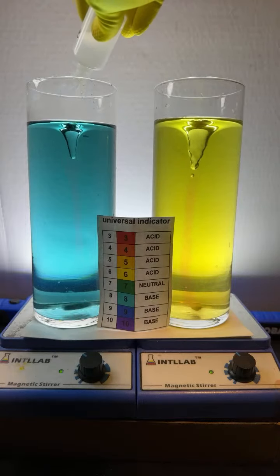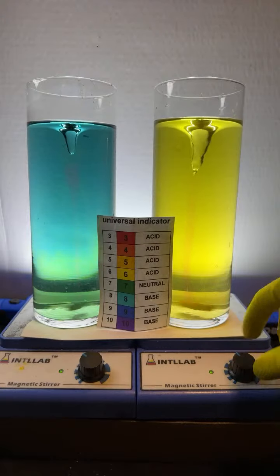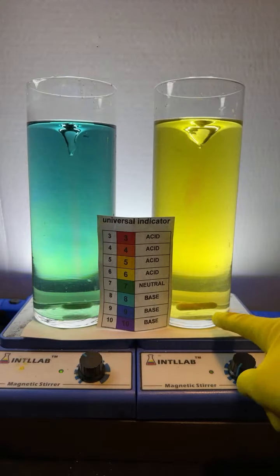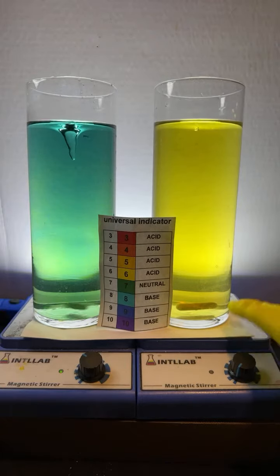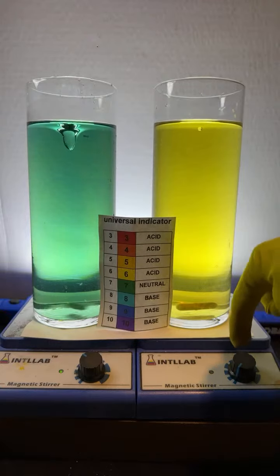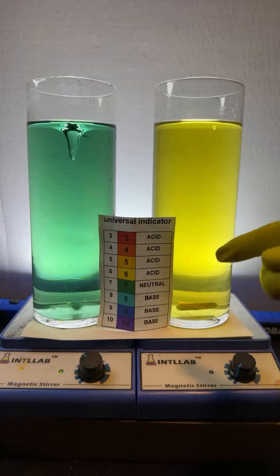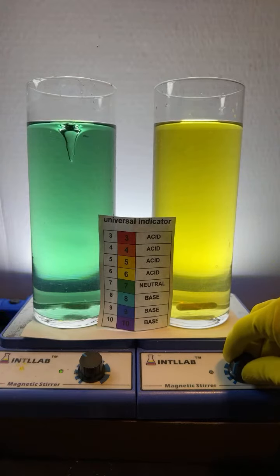I do too, Razormouth. What makes the tornado? So what makes it here? I'm going to turn this off. See that down there? There's a stir bar. That's just a magnet, and it's sitting on this thing. This is like a fan with magnetic blades inside the box. When I turn this knob, it makes the fan spin, and of course, when the fan spins, it makes the stir bar spin.